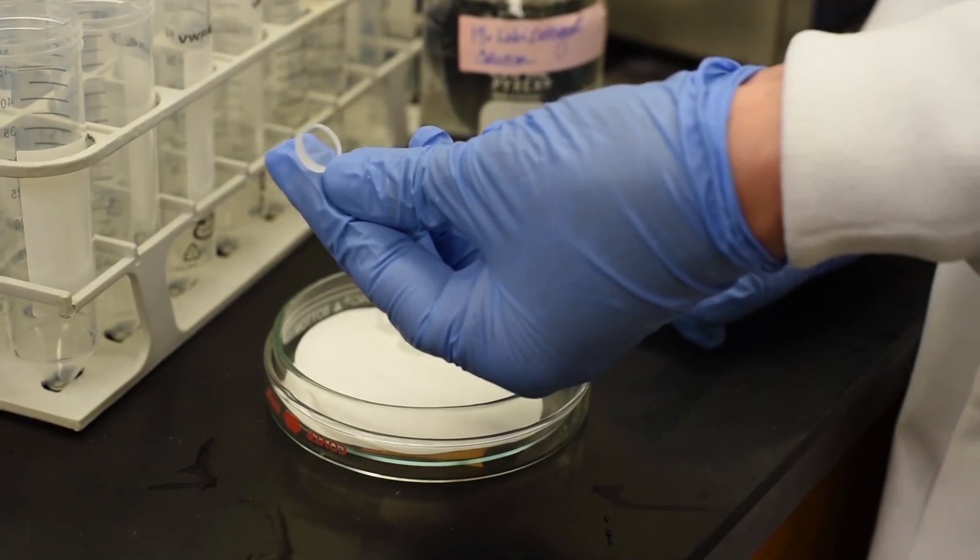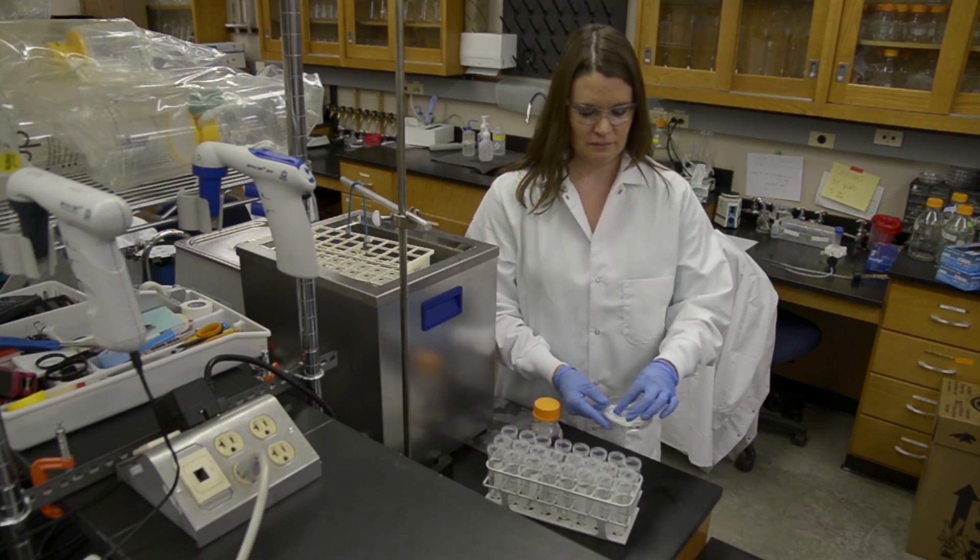Handle clean coupons with gloved hands to prevent oils and other residues from soiling the surfaces.